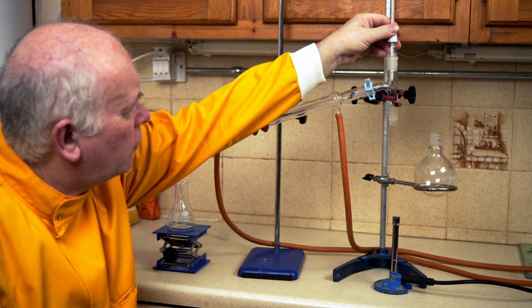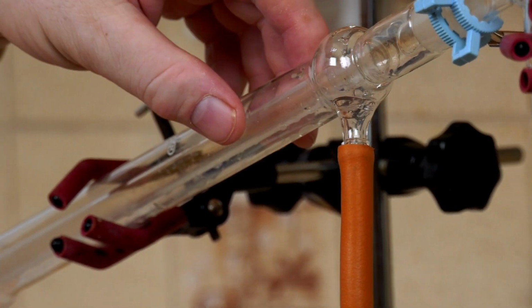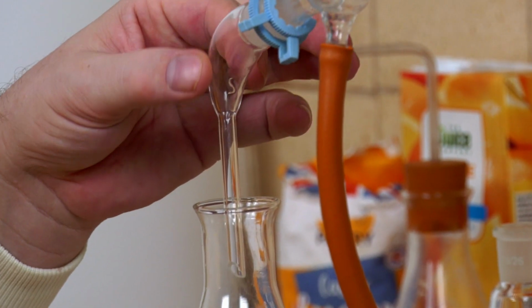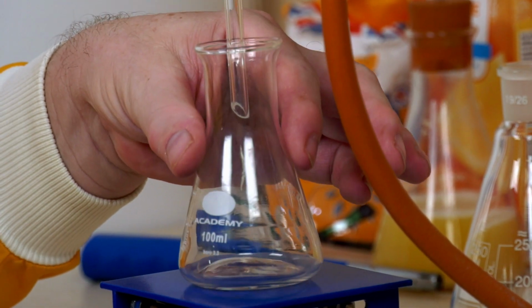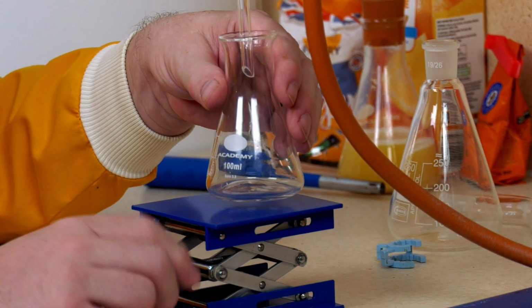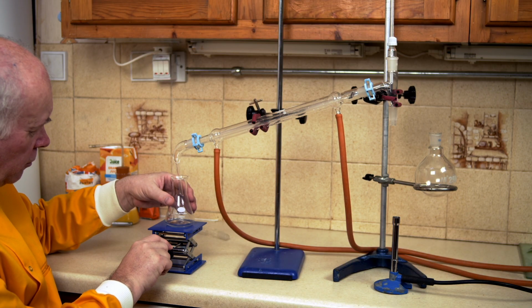And I've positioned the thermometer end so it's in line with this tube, which is then going to run down this inside tube, and around it is another glass tube which we're going to fill with water. And this is a Liebig condenser, and then this will flow out into another little tube which is going to be bent here and catch the alcohol in this conical flask, which I've put on a little jack. These are quite useful for getting the equipment at exactly the right height. So we can adjust this so it's all the right height. So in theory, we're ready to go.